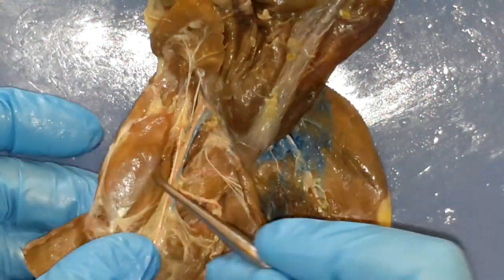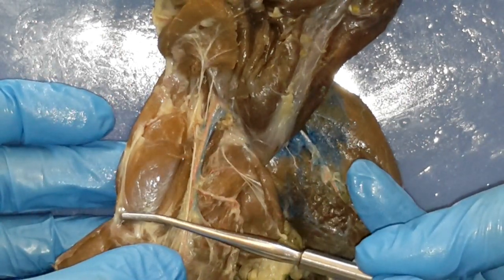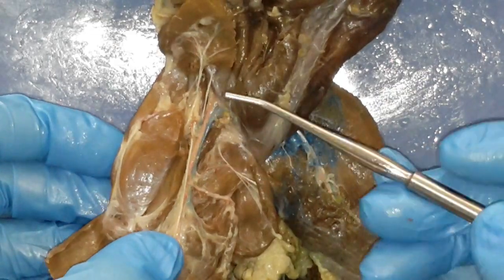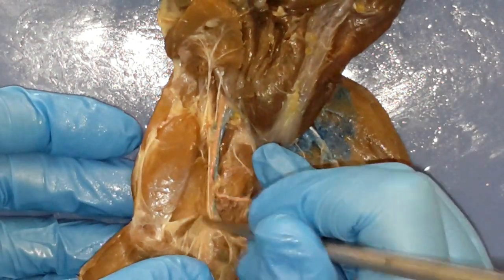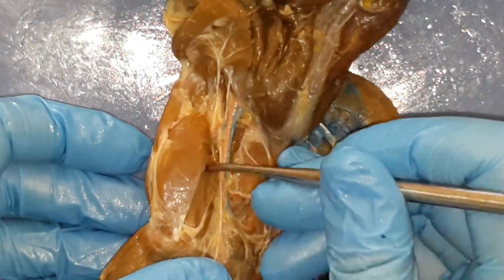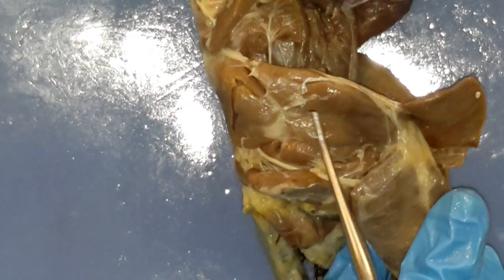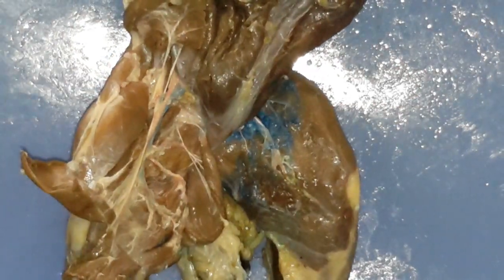We will work on that more, but hopefully you can see this — there's a band of muscles all the way here, and see how the nerves are right in the middle of it. This group is the iliopsoas — we can divide it further into the iliacus and the psoas major, but for now we'll just stick to you knowing this band of muscles, the iliopsoas, as it shows it in the book. A great way to remember is you have these nerves that kind of run up in between them. Then a couple more things: this nice big broad muscle here — what's that one? Look in your picture. Rectus femoris — it's one of your quadricep muscles. You have your rectus femoris, then kind of underneath that you have your vastus medialis. And then the other one we didn't talk about on the other side — after you bisected your bicep femoris, you have your vastus lateralis.